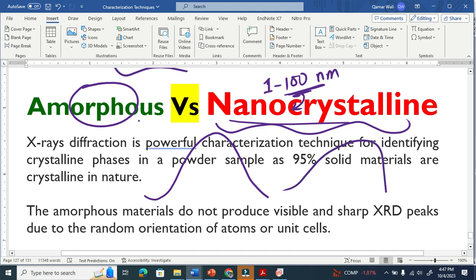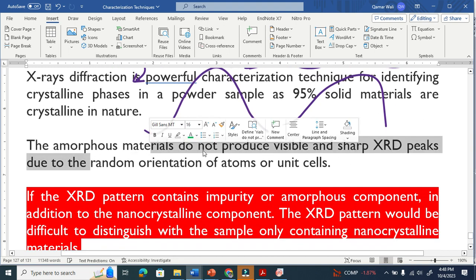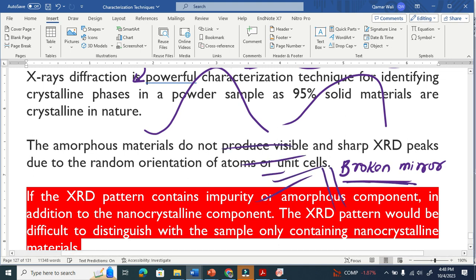So how will you know whether our material is amorphous, or there are some impurities, or whether it is a nanocrystalline material, right? We know that the amorphous material does not produce visible or sharp peaks because, as I explained many times, amorphous material is something like a broken mirror. When you shine light on a broken mirror, it will give you diffuse reflection. It will not give you any intensity. So this is the diffuse pattern that amorphous material gives.